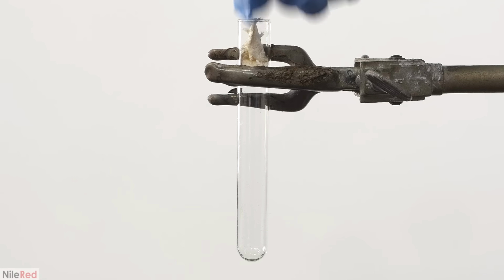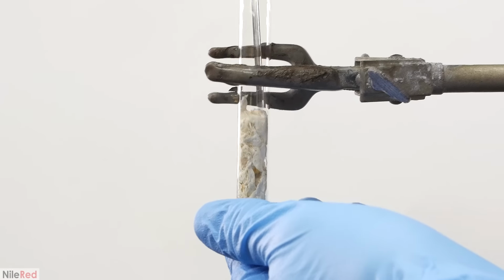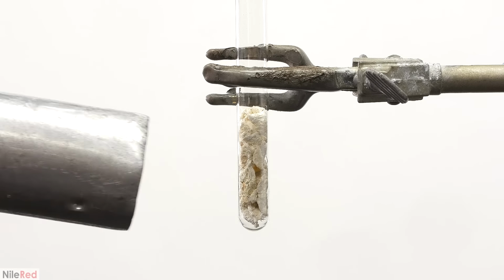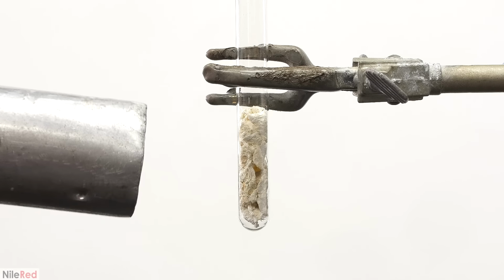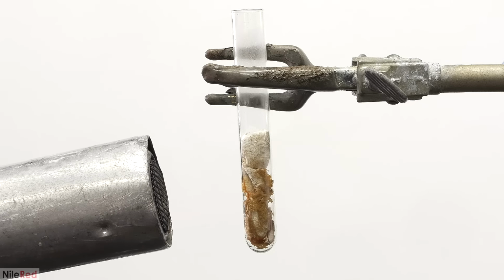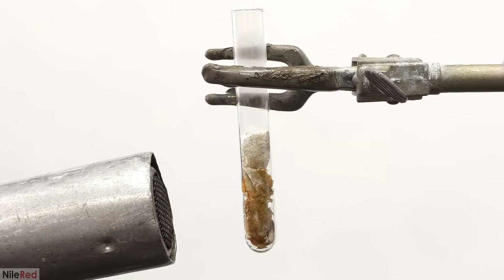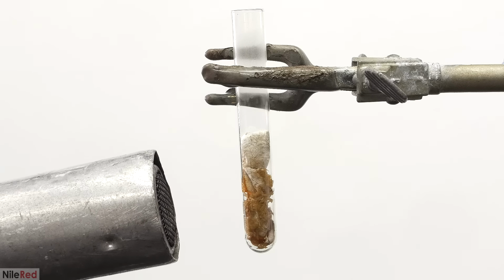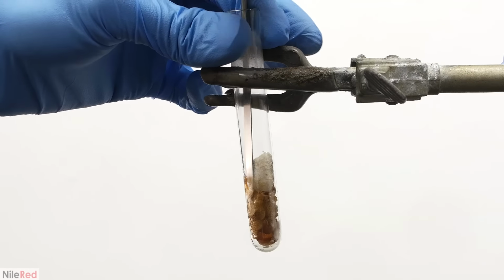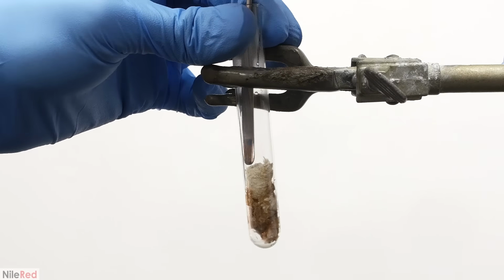All of the nylon pieces were then shoved into a small test tube. I started blasting it with a heat gun, and the goal now is to completely melt it. The melting point of nylon is around 265 C, so this is going to take a lot of effort. It's also possible to use a Bunsen burner or a blowtorch, but I really didn't want to burn things. I occasionally had to stop and shove everything down to the bottom using a metal spatula.